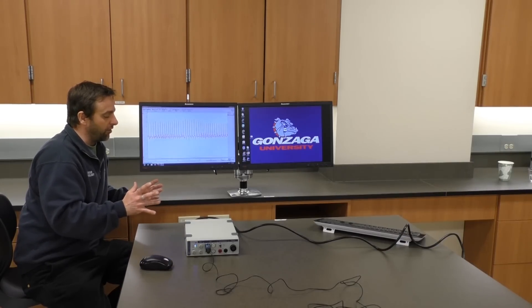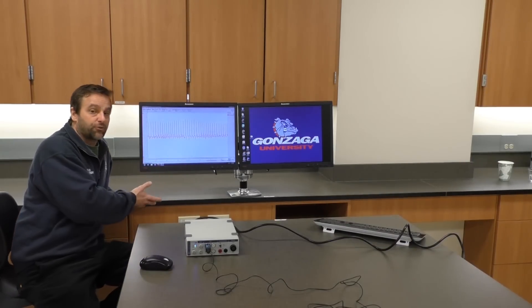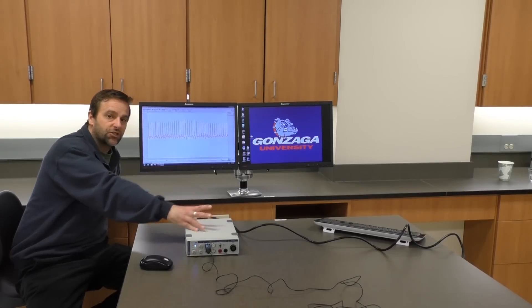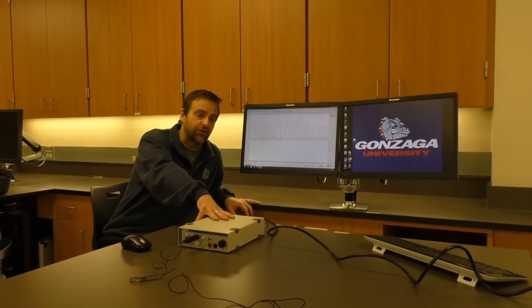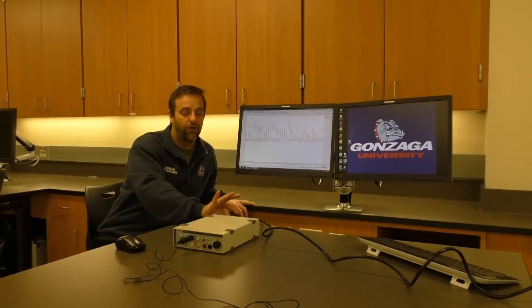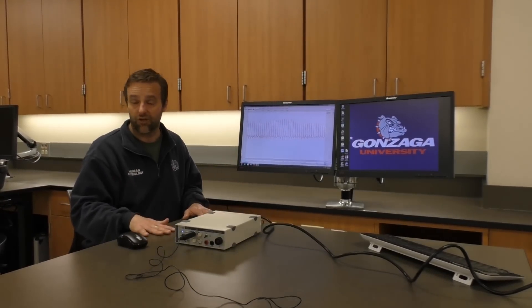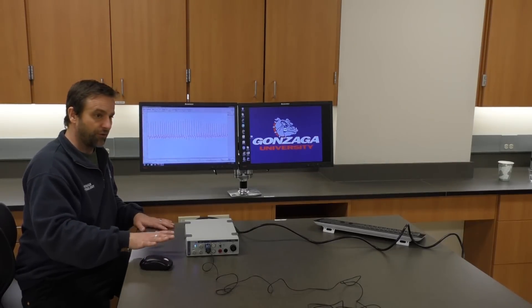That's a simple measurement of just the change in pressure in my finger, which gives us a representation of heart rate on the screen. This is a nice easy introduction to PowerLab because we only have one wire to hook up on the front and we go through the basic setup. Do read the protocol before you come into lab — it's going to help you get this set up and working properly. Make sure you've hooked up the power cable and the AD Instruments box to the computer, and that you're not having any interference from electrical devices around the room. You'll enjoy this week's lab — thank you very much for your attention.